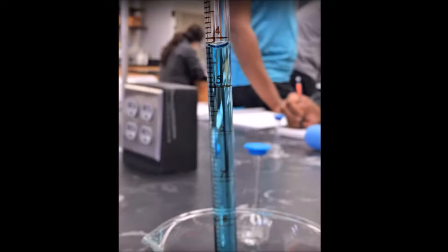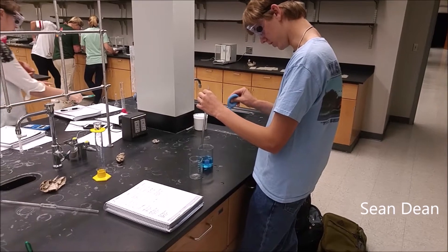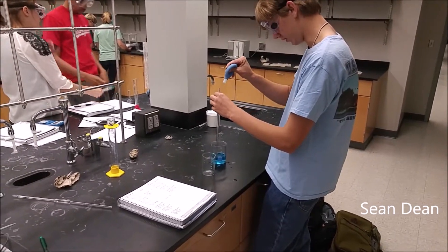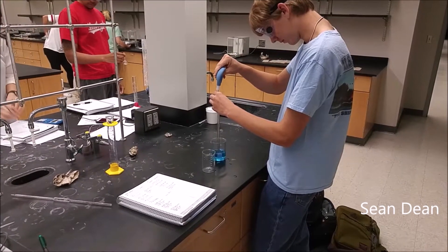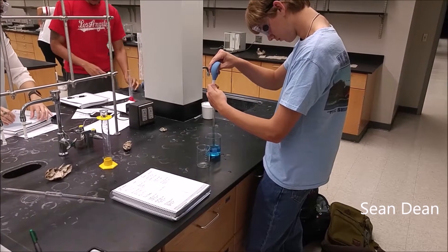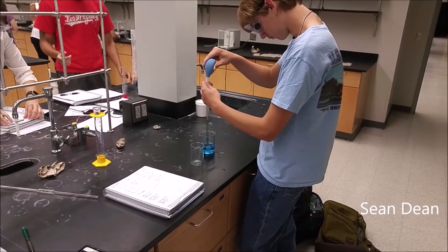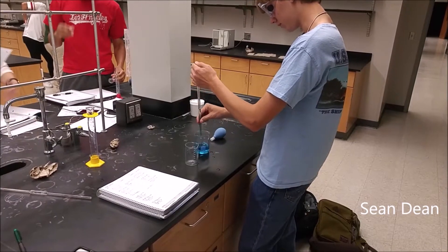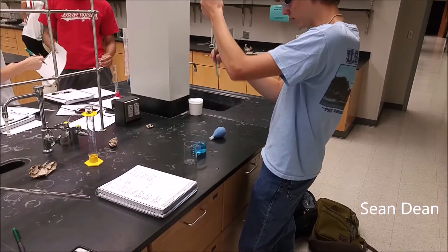Before you pipette, you must know how to read your measurements. When measuring the volume of a liquid, you must measure by reading the meniscus. The meniscus, which is the curved upward surface of a tube, occurs when the molecules of a liquid are attached to the container. To read the meniscus, you must read it at eye level and measure it from the bottom point of the curve.